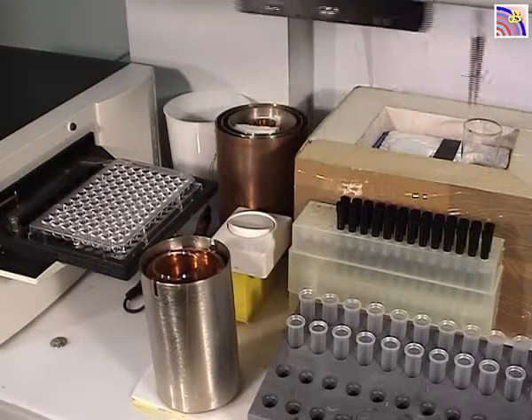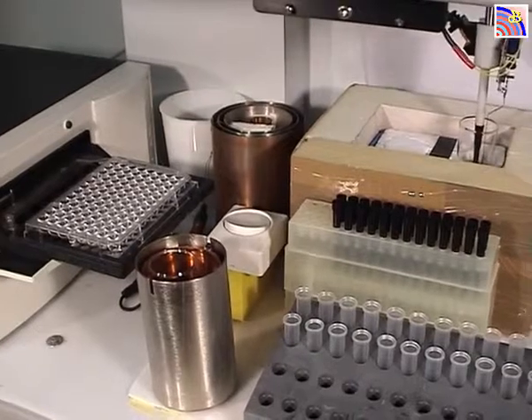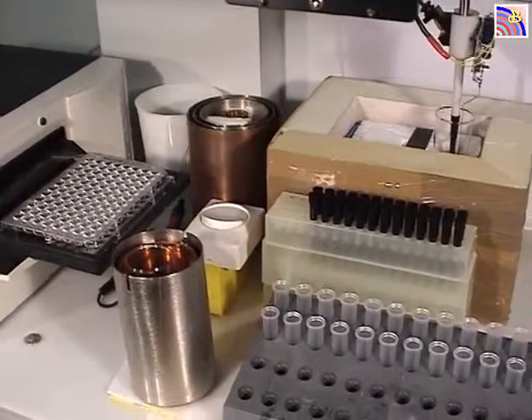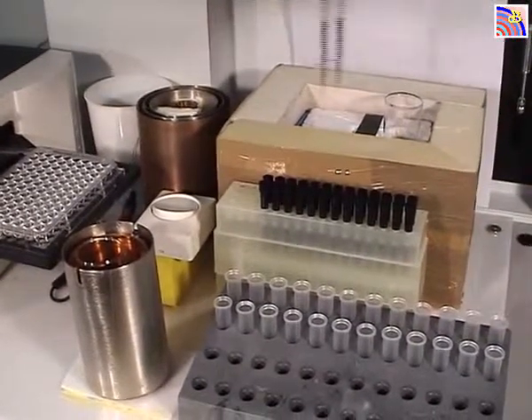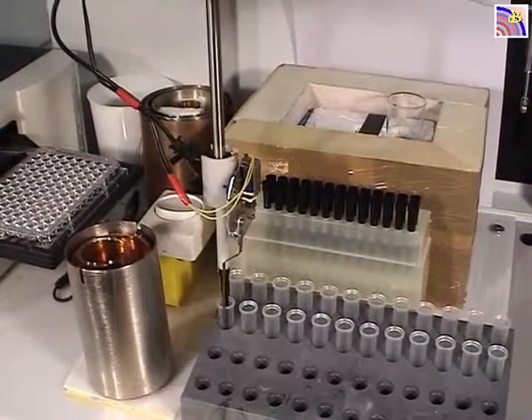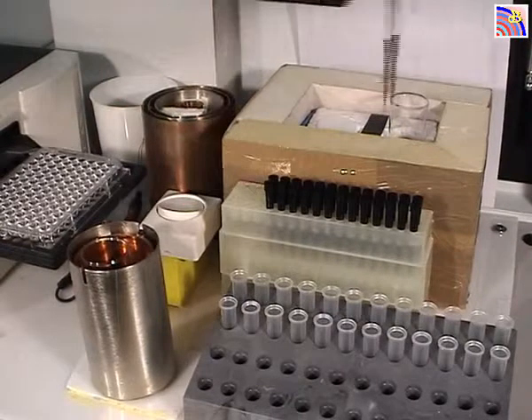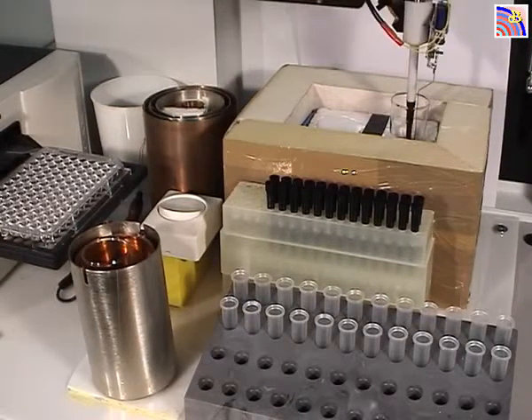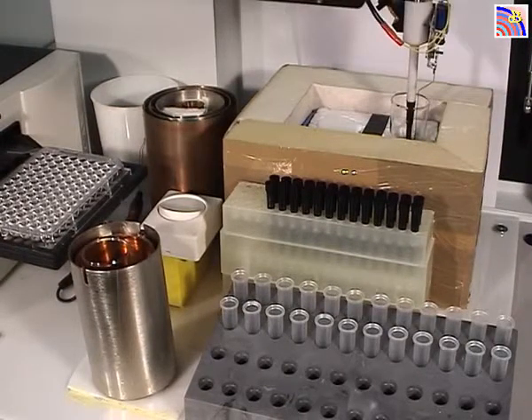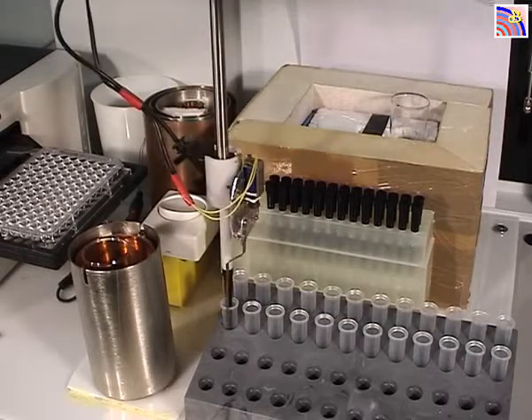Now the machine is collecting the plasma and will put it in front. Each sample is always 200 microliters, so that will be 200 plus 200 — 400 microliters total.